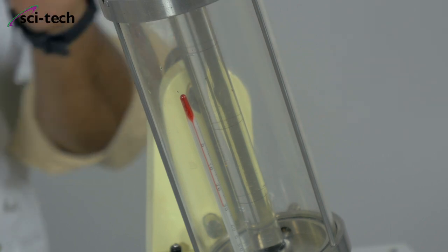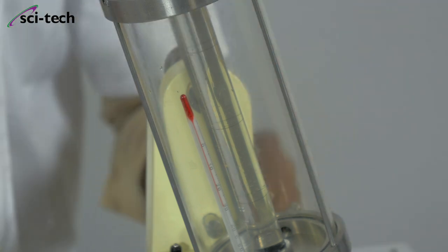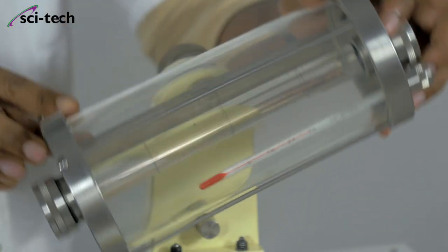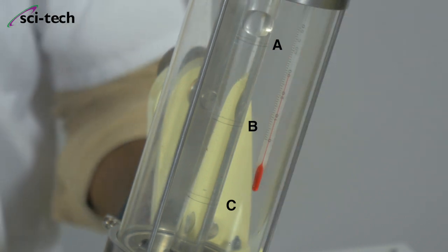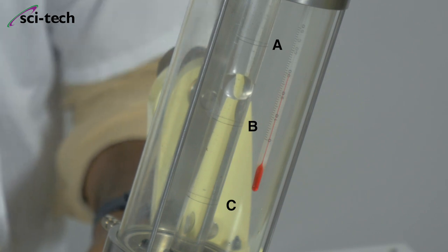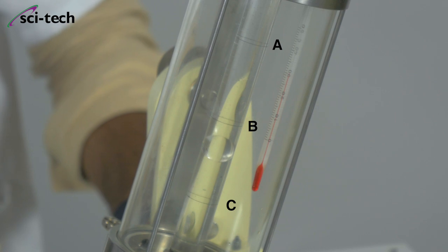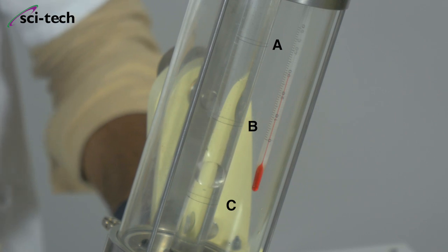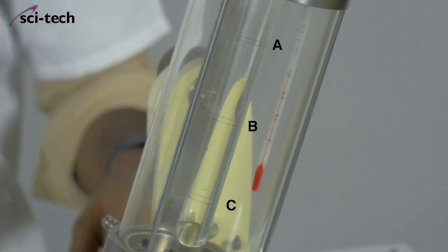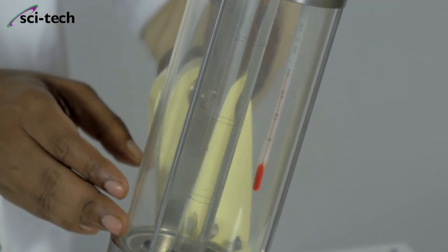We take the mean time because sometimes air bubbles are inside the glass tube. So we turn it again at 10 degrees and calculate the time again. I start the watch at ring A and the ball goes down under gravity inside the Newtonian fluid at 10 degrees. It reaches ring B, then the second reading comes to 24.15 seconds. So the average time is (24.57 + 24.15) / 2, which comes to approximately 24.3 seconds.